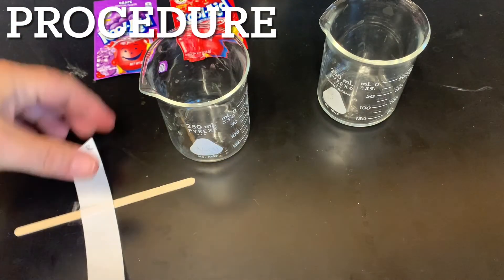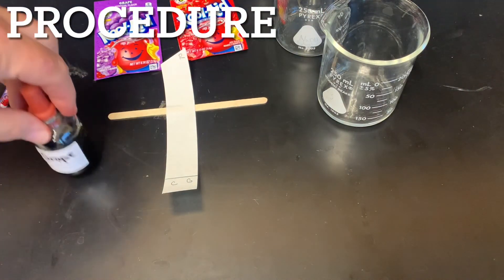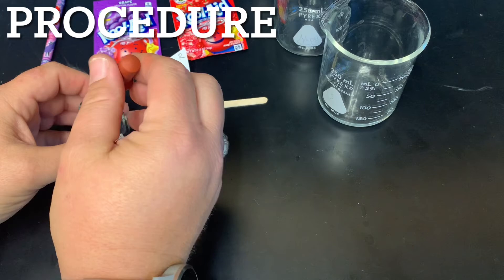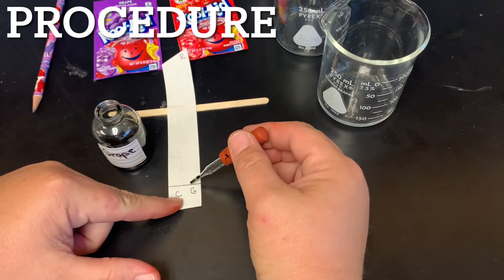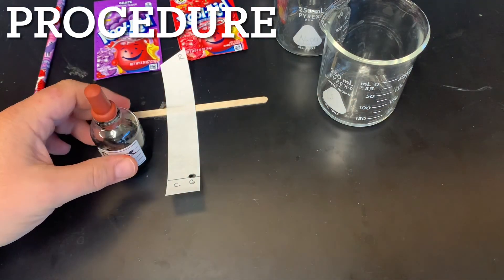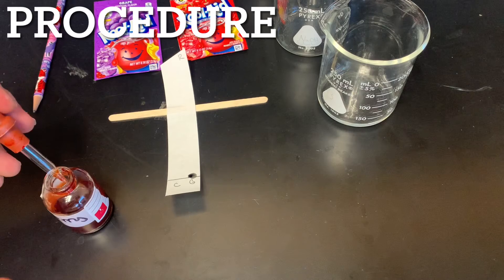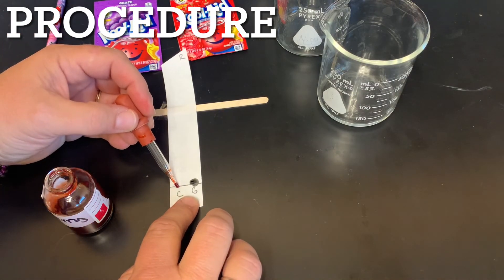Once I have that set, I'll take it out. I'm going to get the bottle — we all have to share these bottles. Here's my grape, and this is what I'm testing. I just get a little bit right here and put one drop on that line — that's all it will take, just a little drop. I'm going to run cherry against it as well. There's no squeezing of the pipette; there'll be enough in the bottom. I just place it on that line.